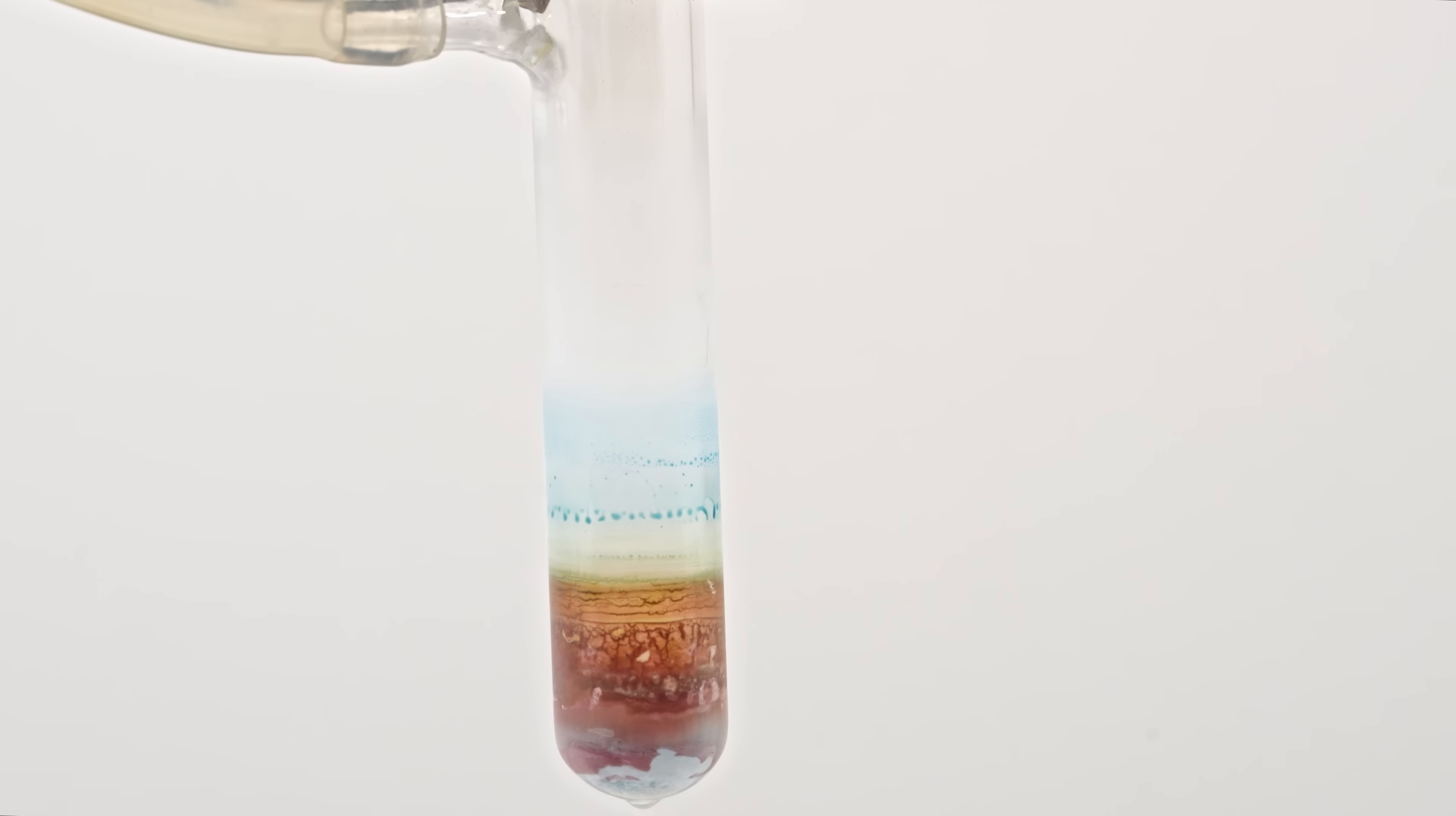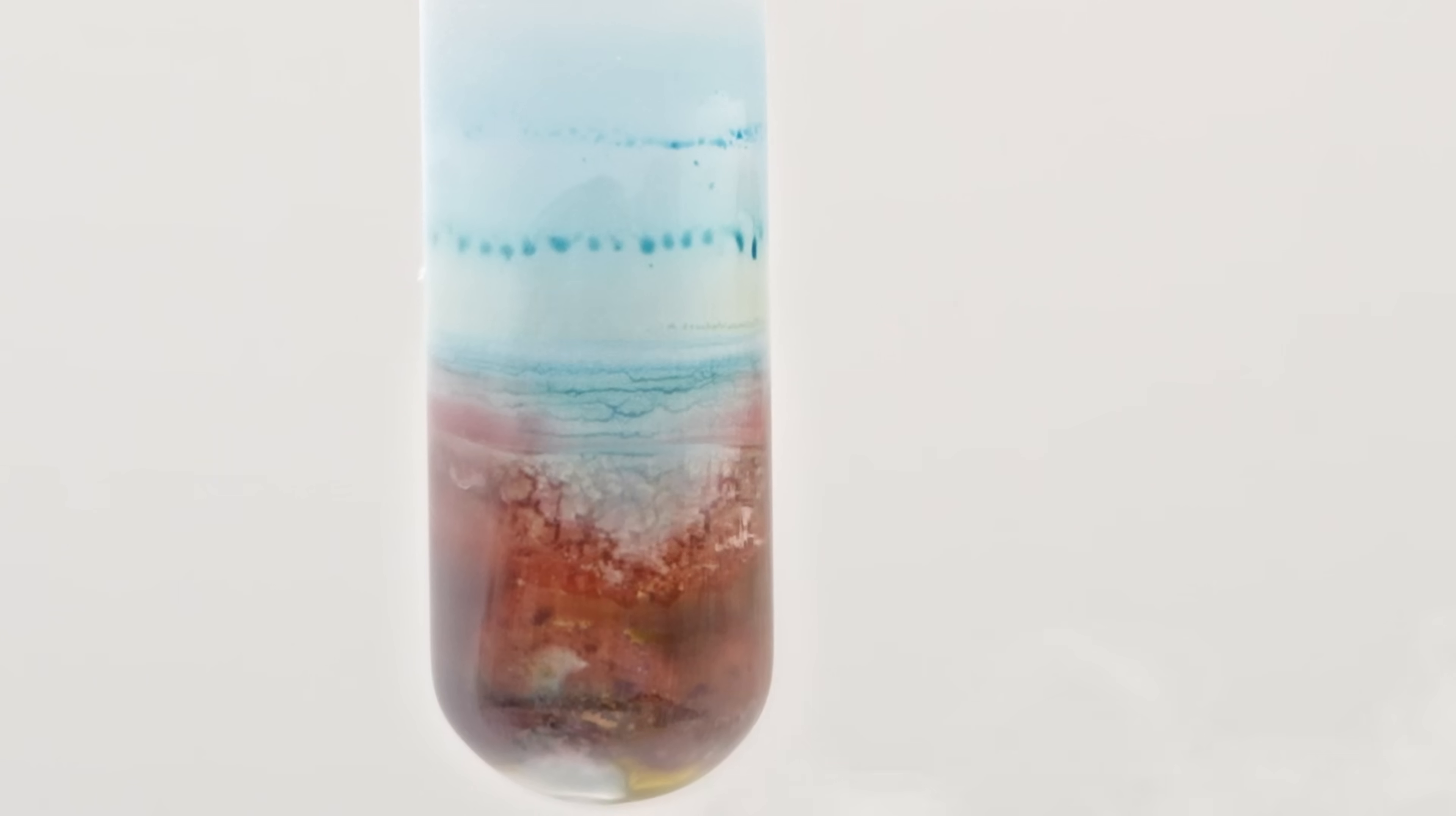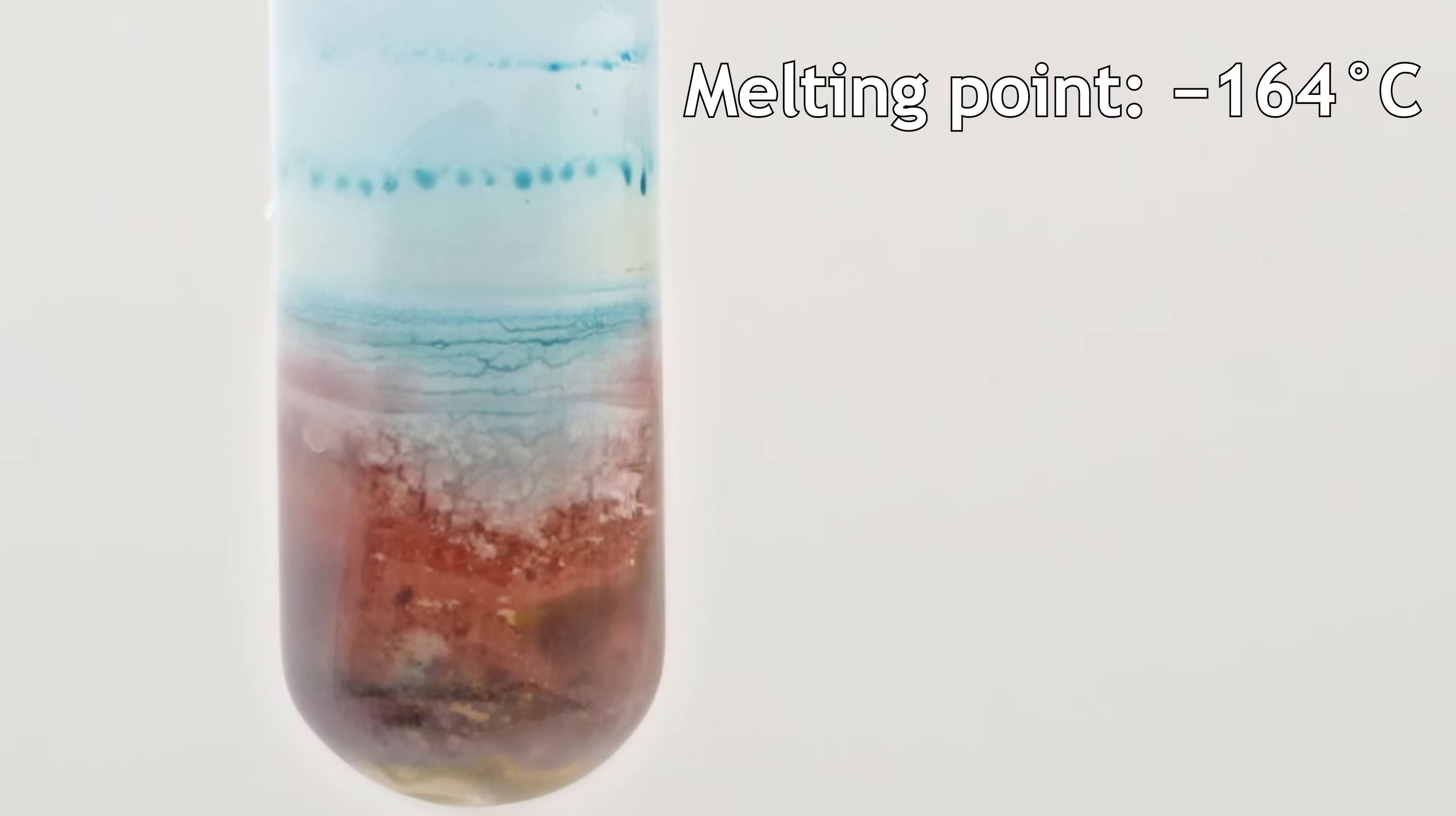Removing the test tube from liquid nitrogen reveals the solid red dimer, which melts quickly due to its low melting point. The red color also disappears rapidly.